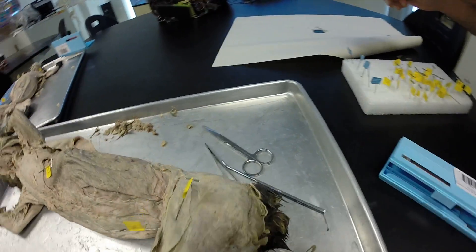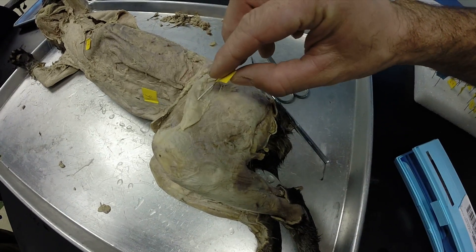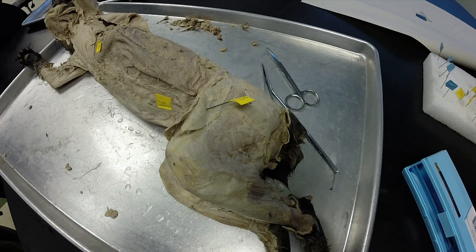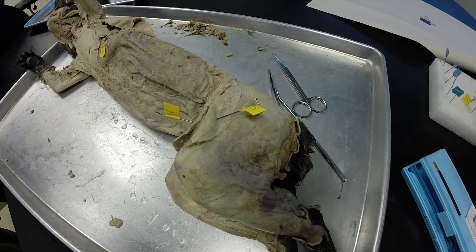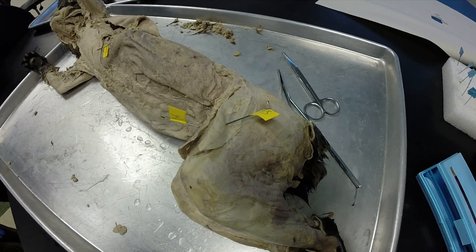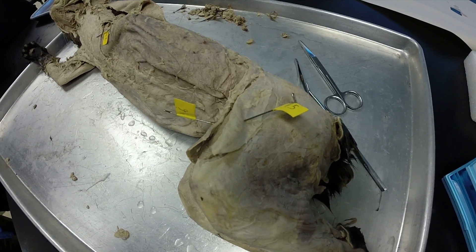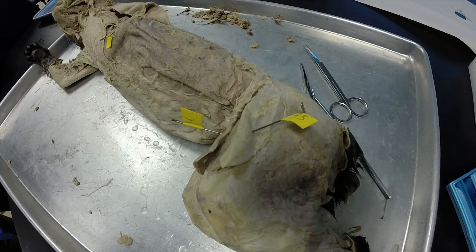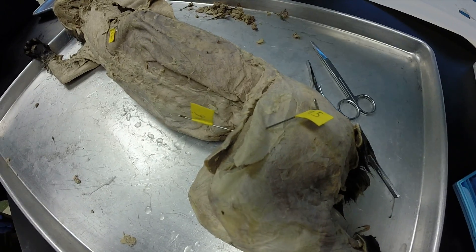On this side of the cat, this is one of those deals where you definitely want to make sure you read the directions. The directions say identify this connective tissue, so that's going to be your fascia lata — not the tensor fascia lata. If it had said name this muscle, it would have been the tensor fascia lata.